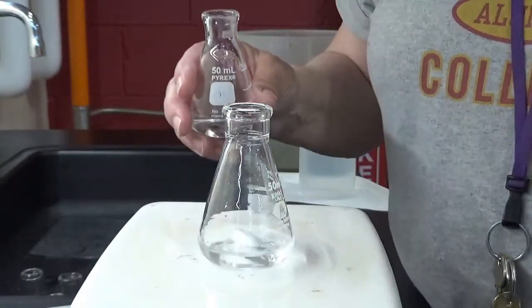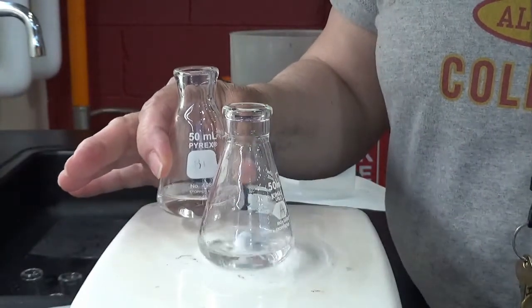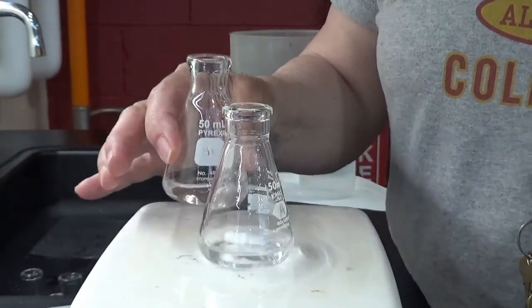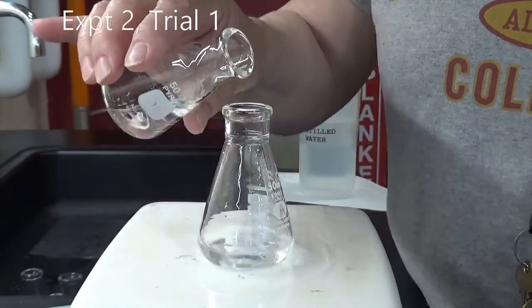That's on A, right? This is A. Yeah. And this is B. And when I add them together, start your timing. When it turns purple, stop. On the first sign of purple.